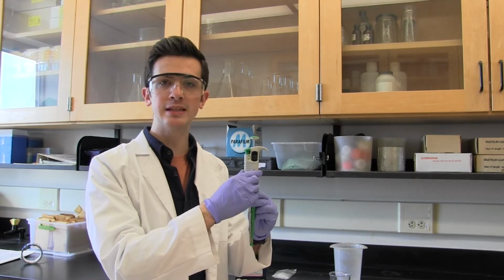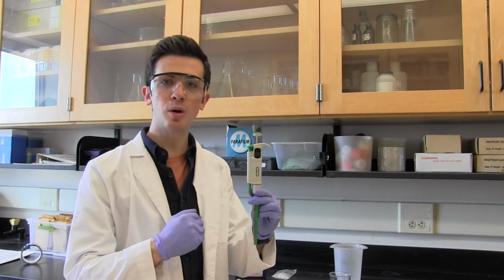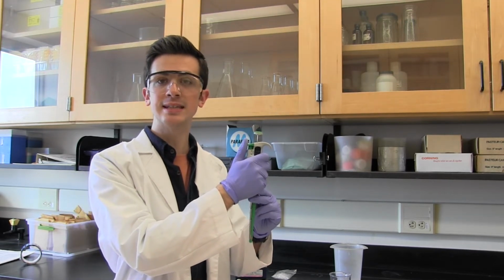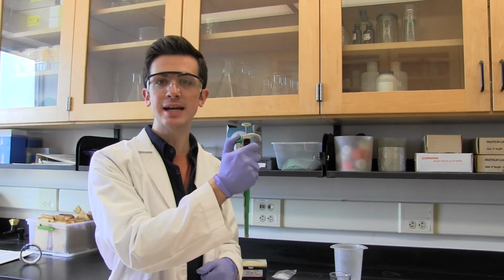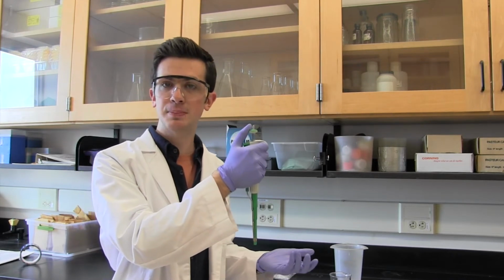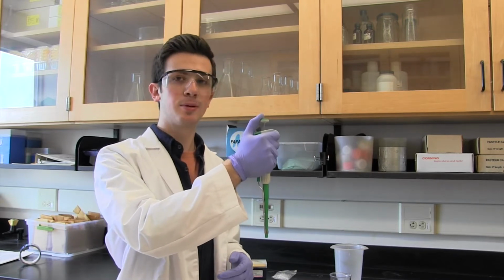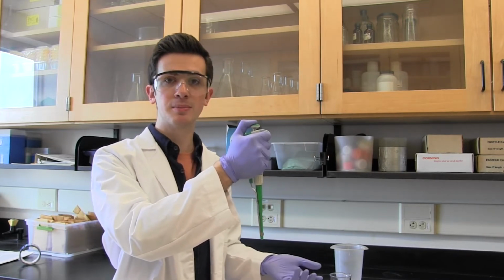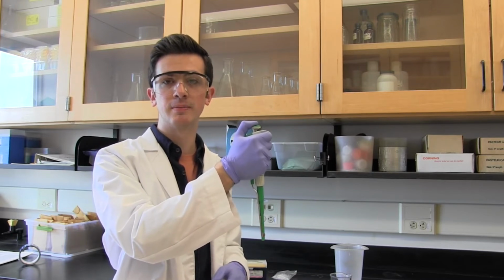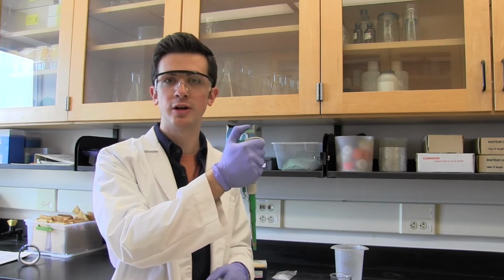You might not be able to see these well in the video, so I'll describe them. The ejector is a smaller button on the side of the pipette. You can place your thumb on it and it does exactly what its name tells you. It ejects the pipette tip. The plunger on top is used to actually pick up and transfer solutions. It has 2 stops. Depressing to the first stop prepares the pipette. You're going to want to do this generally before you insert it into a solution. Depressing to the second stop is something we'll get into later during our demonstration.